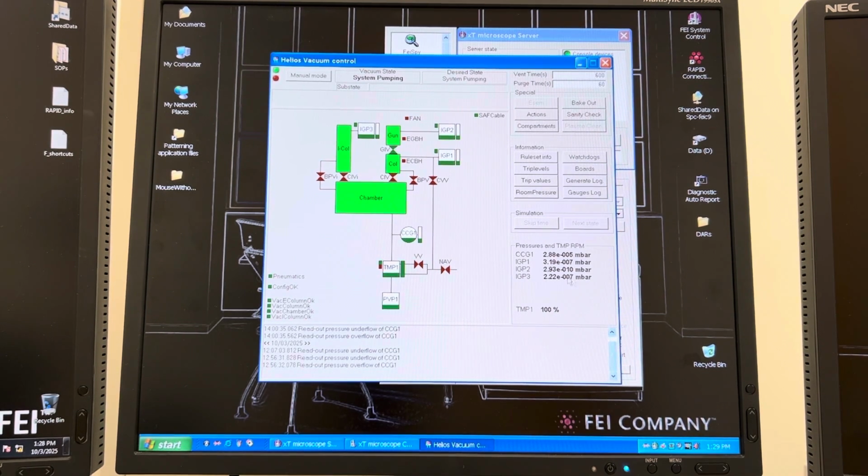Anyways, the units for this are all in millibar. In the actual UI, you can set this to be in different units if you want, but in the actual server window items here, they're in millibar. Anyways, there are trip levels, so you can see all of these are in green, so we're below the trip level where it's satisfactory to actually use the microscope. But this is actually not very good. Even though it's passable, this is not very good as far as vacuum is concerned.